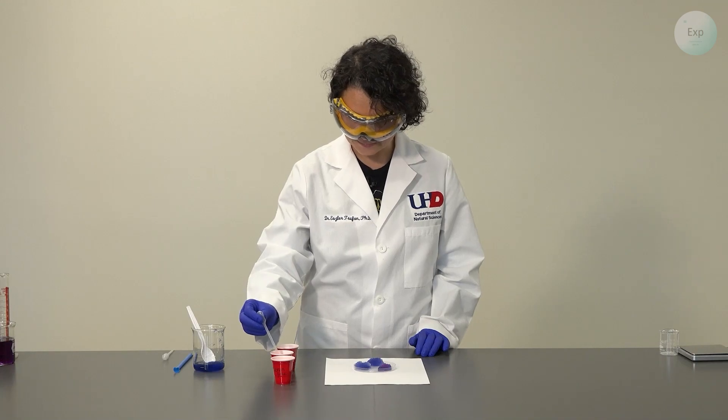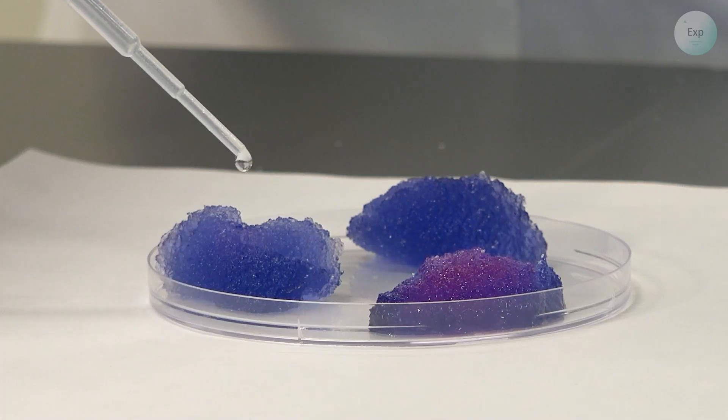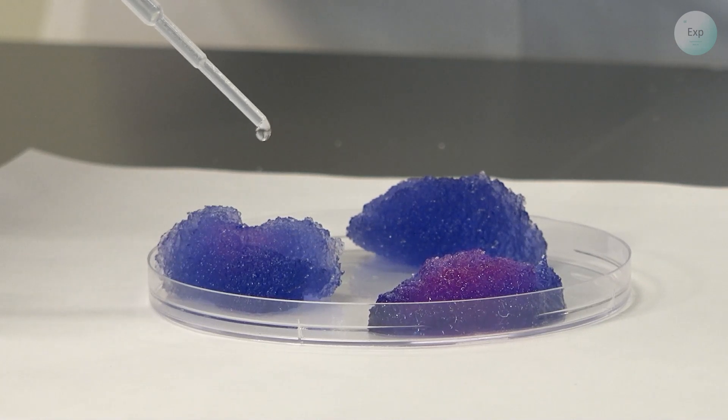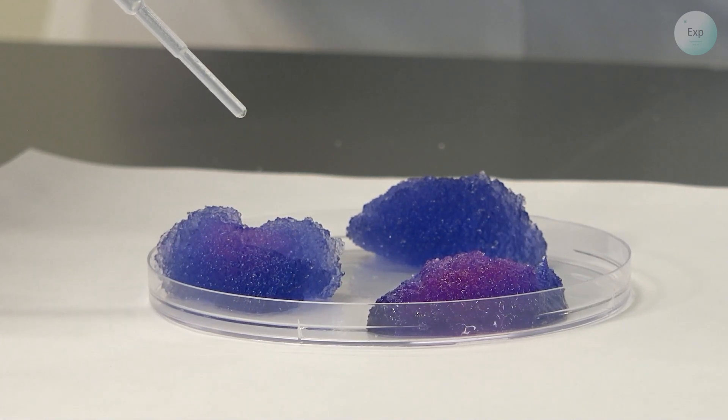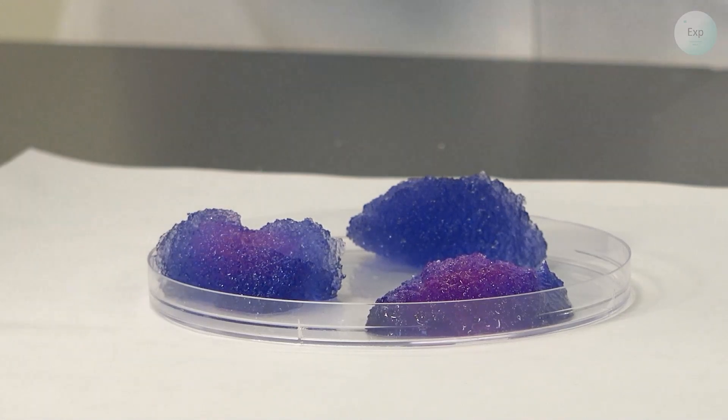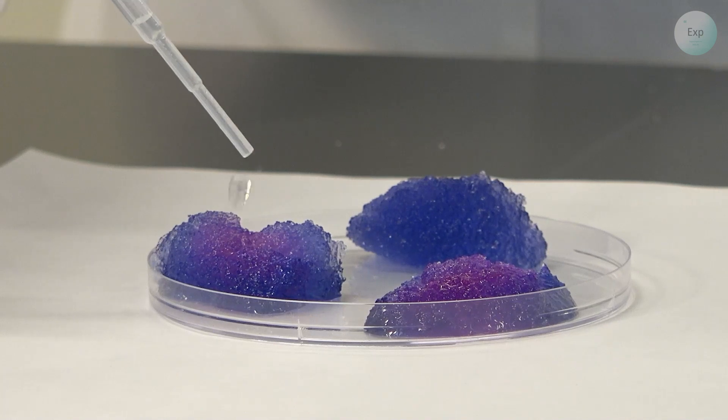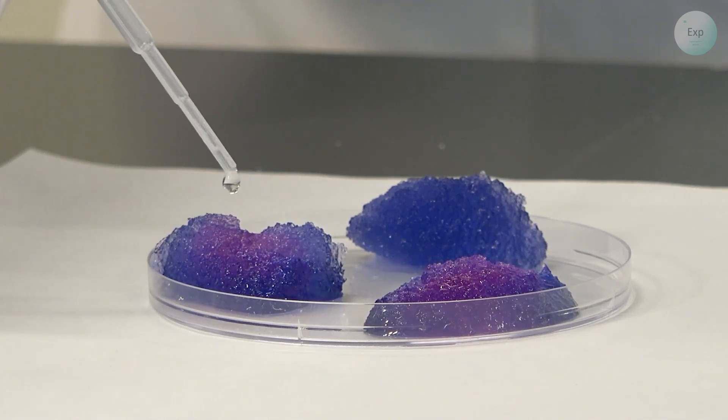Let's try again with the vinegar. It's a little slower, but we can start seeing a color change here as well.